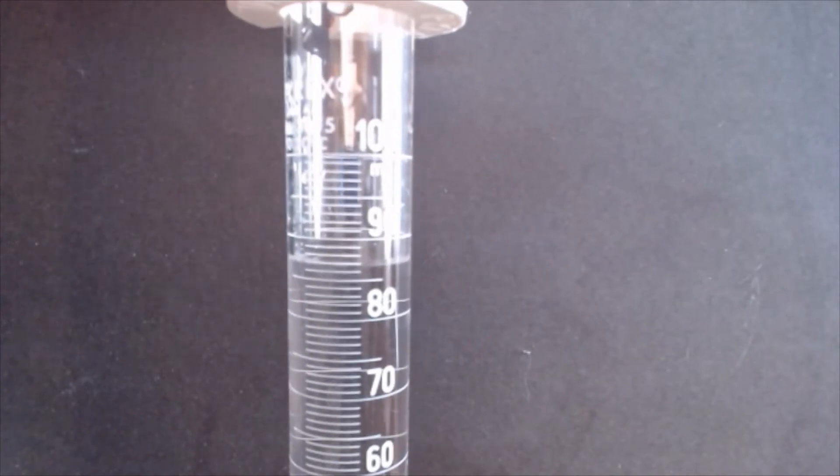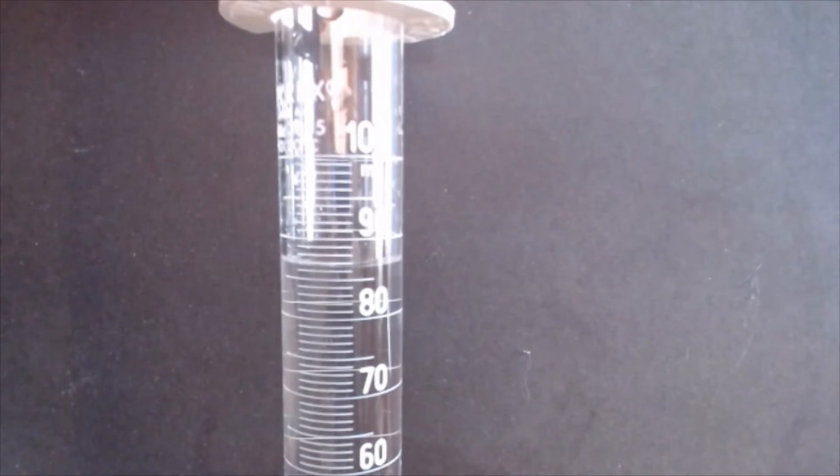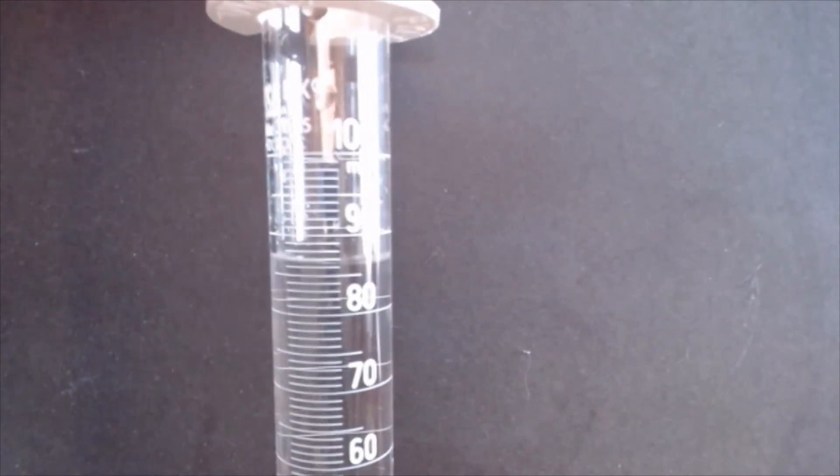You guys can take your own reading, but I get about 86.2 milliliters, 86.2 milliliters.